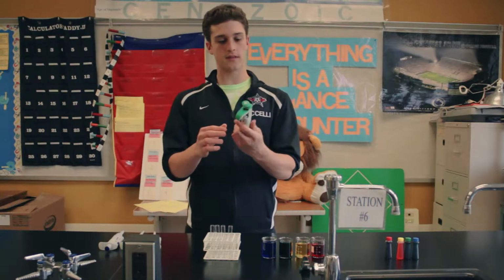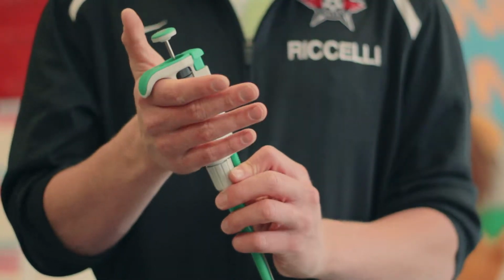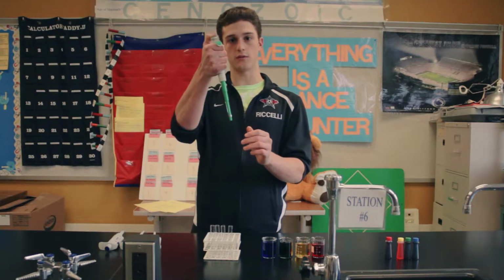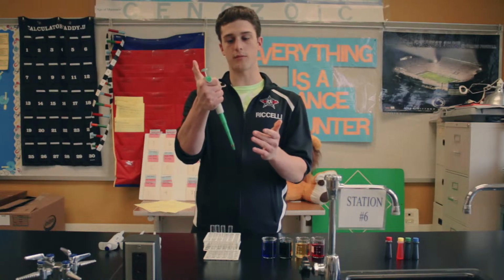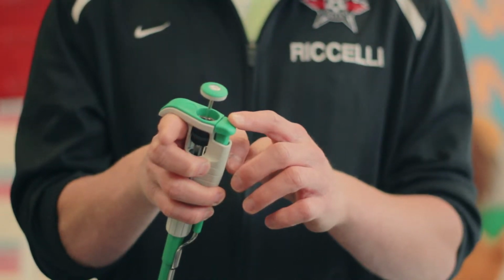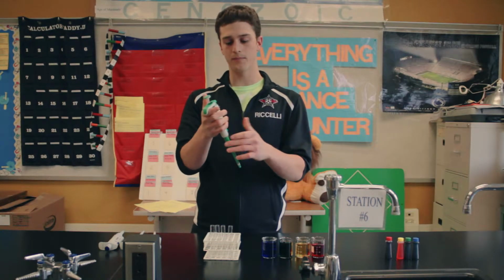So the parts of both of them are basically the same. This is, we call it the plunger, and you're going to use this to add your sample. This is the handle. You hold a micropipetter like this, and this button here is what you're going to use to eject the tip of the micropipetter.